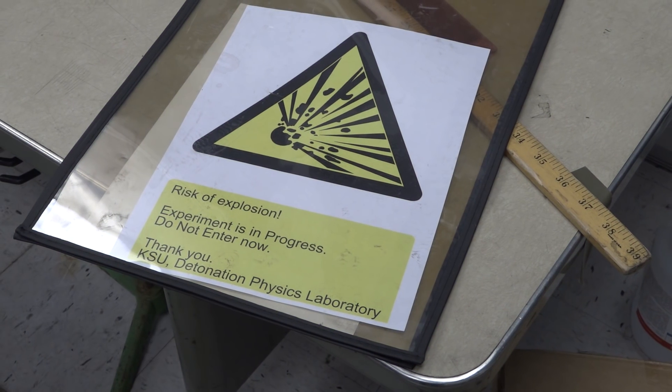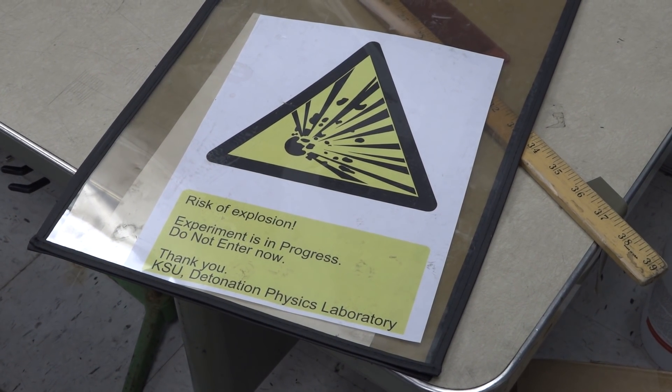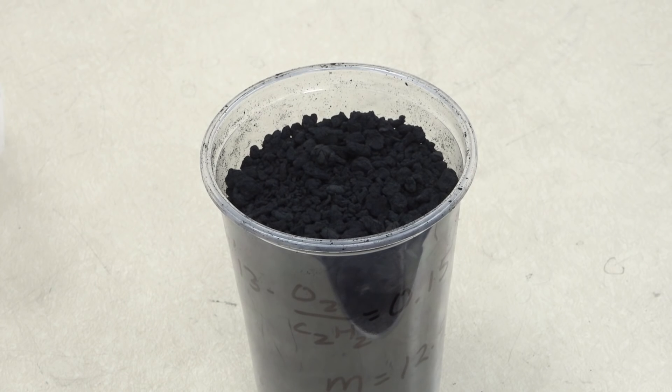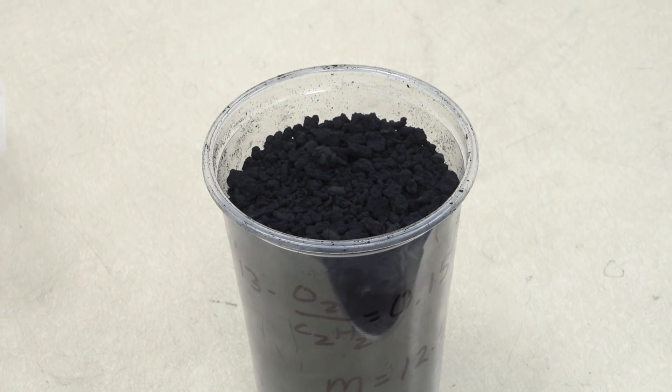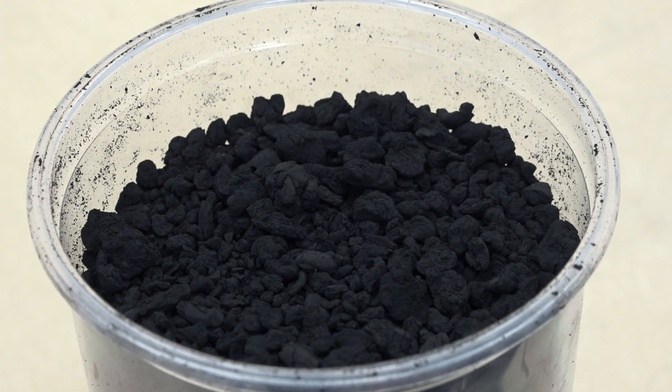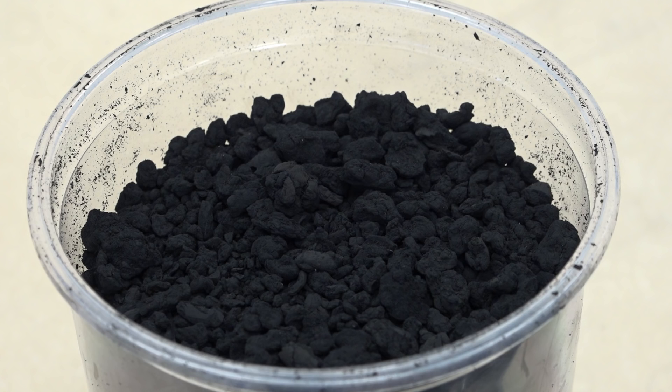The risk of explosion — the experiment is in progress. We make graphene by this hydrocarbon detonation technique.